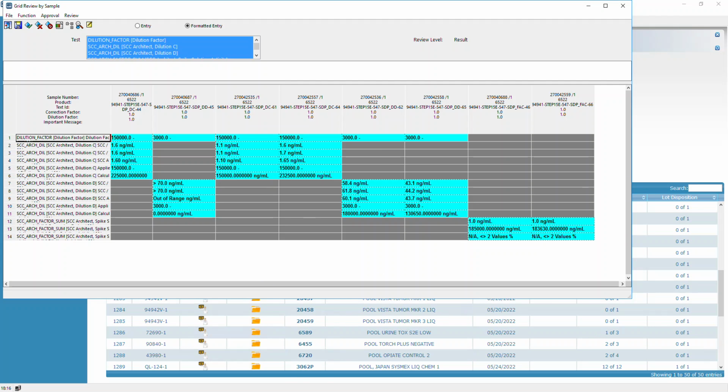Okay, so I've loaded up the results into results review as I've shown before. In this case, we're looking at SCC, squamous cell carcinoma antigen, and it had a base value of 1, or less than 1, so we're going to consider it 1. And so this is what happened.